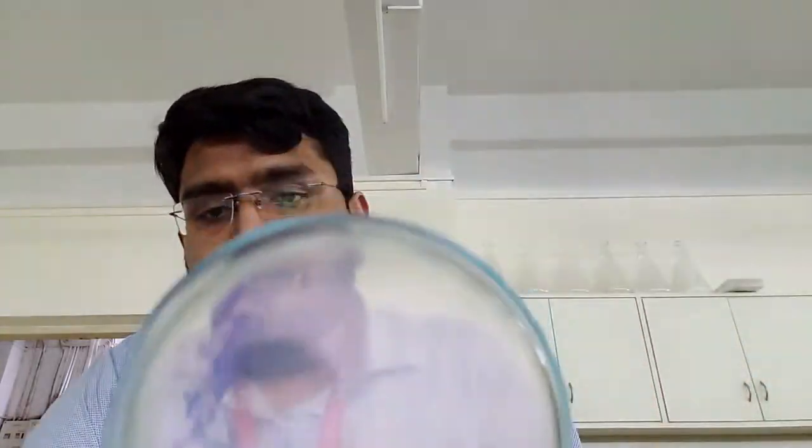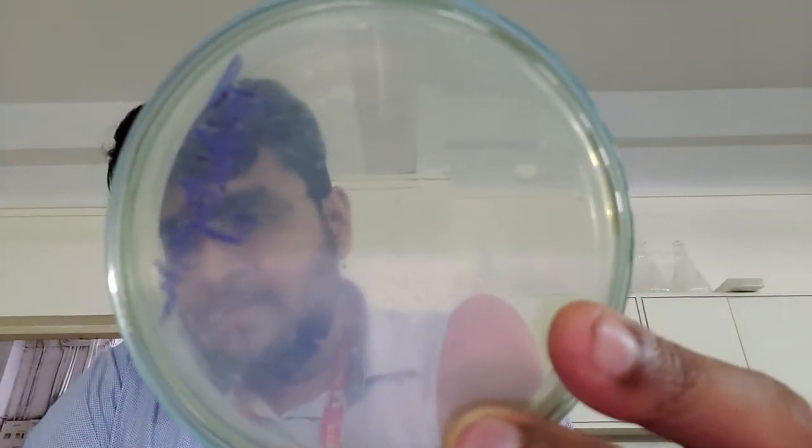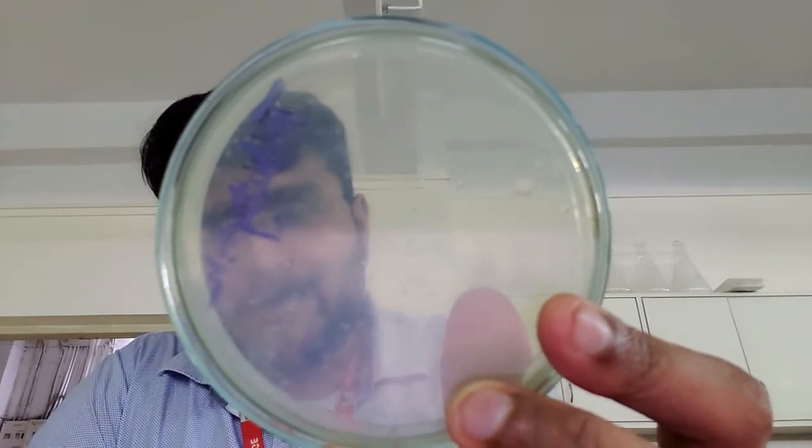I'll be passing a few strains on this plate and incubating it depending on the strains I'm using. I could do a proper isolation technique or even spot-inoculate and look for a zone of clearance after growth. It's actually — I don't know if it's very clearly visible — but you should be able to see droplets on the plate.